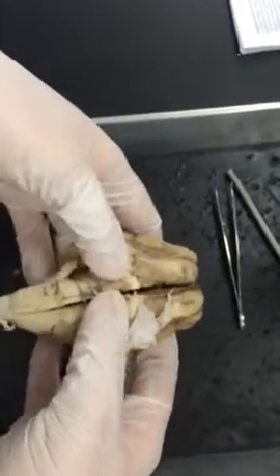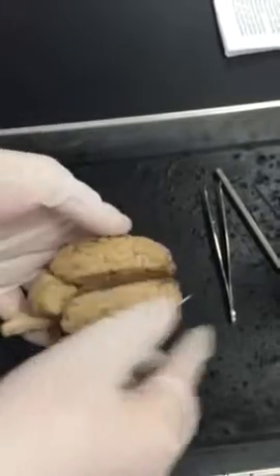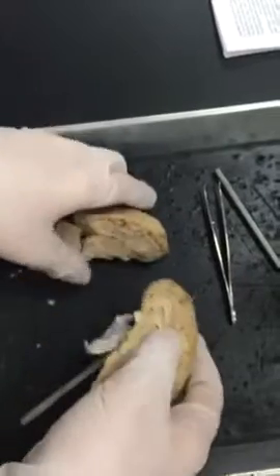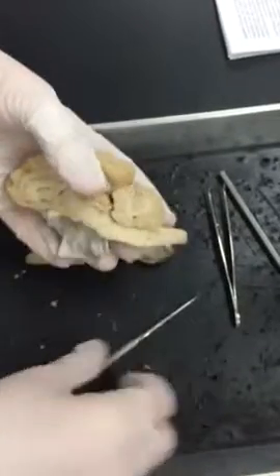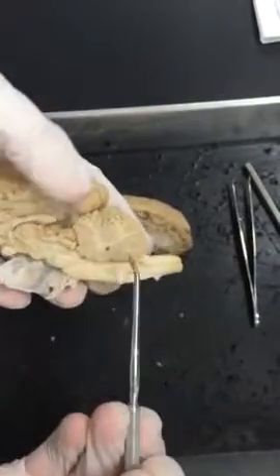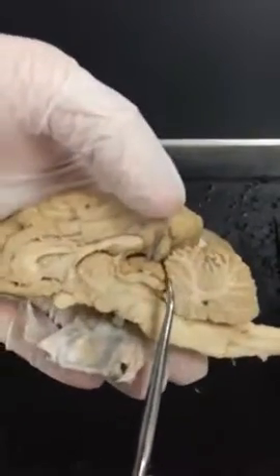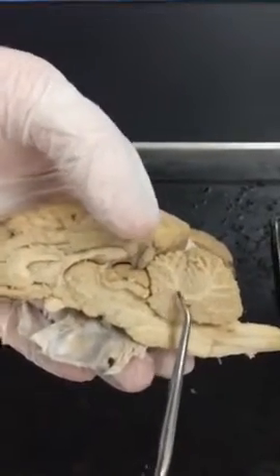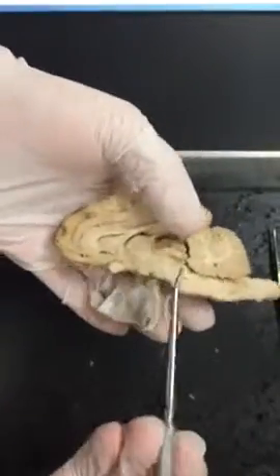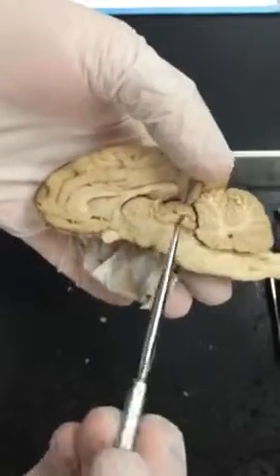So now we're going to take it apart. We cut down the longitudinal fissure, and that breaks it into the 2 hemispheres. So when identifying inside, you still have your cerebellum, and inside the cerebellum you can see the branching, thicker white area, which consists of white matter. Then you still have your pons and medulla oblongata.